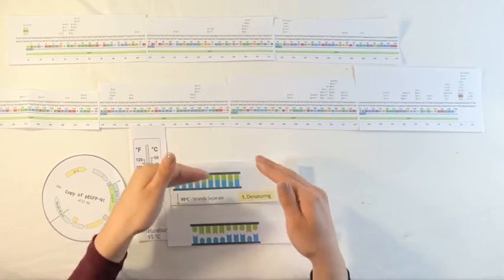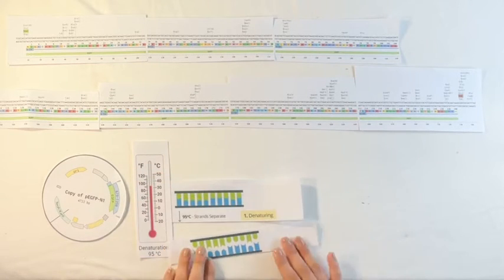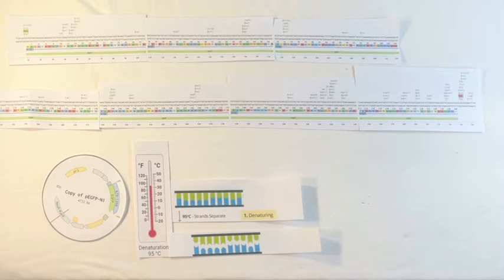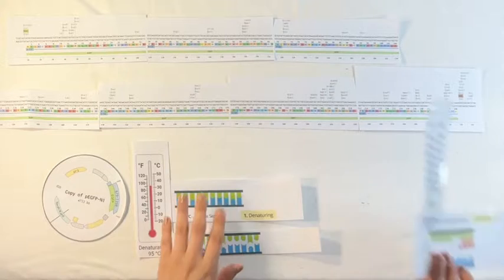Once the DNA has been separated, we're then going to decrease the temperature to about 60 degrees Celsius.